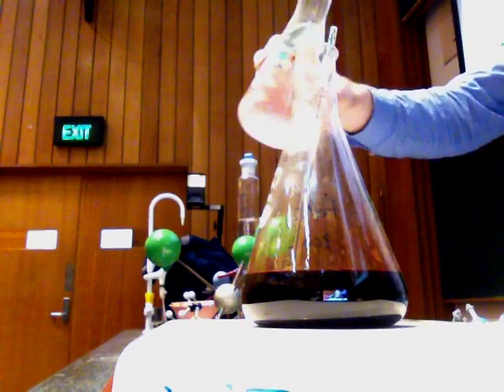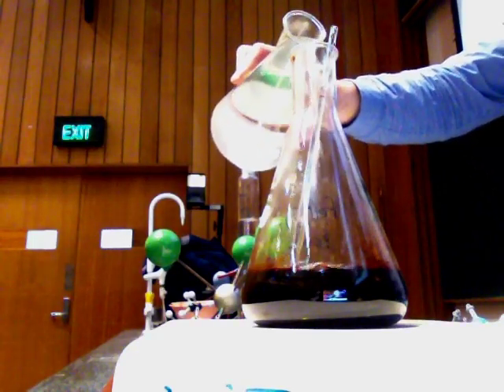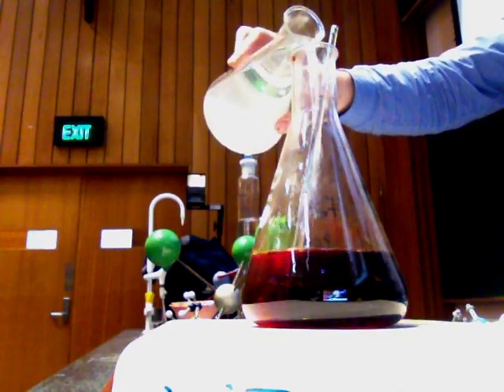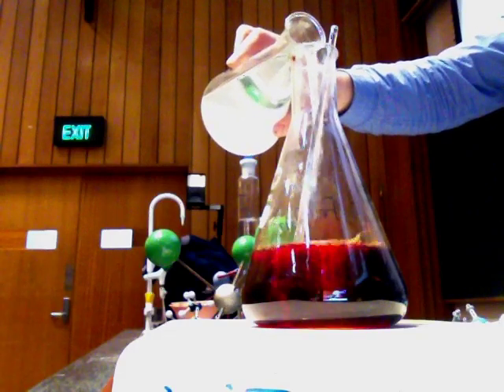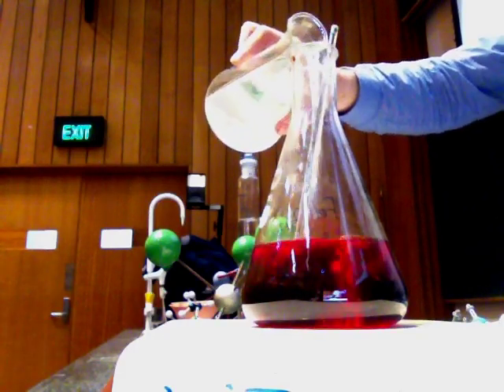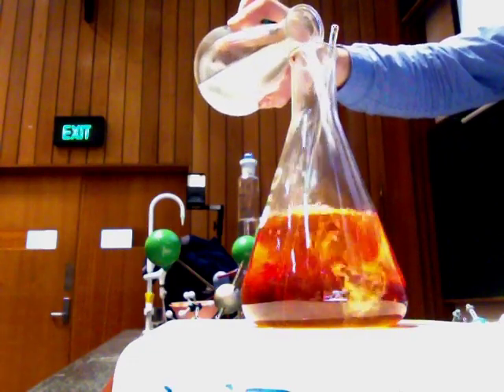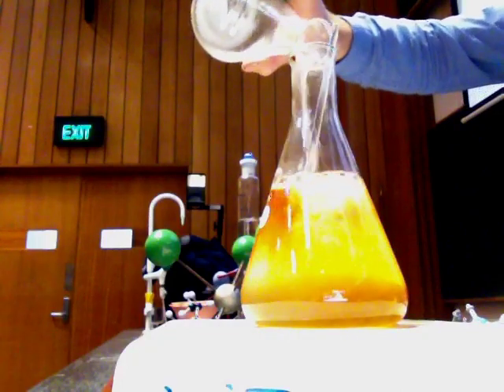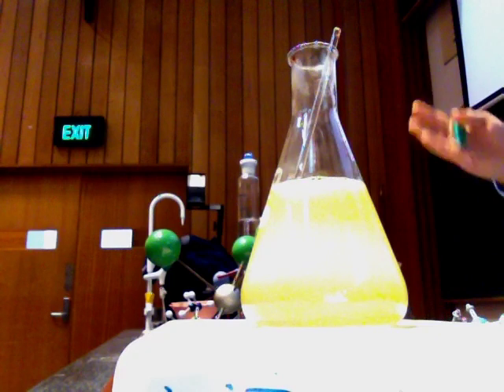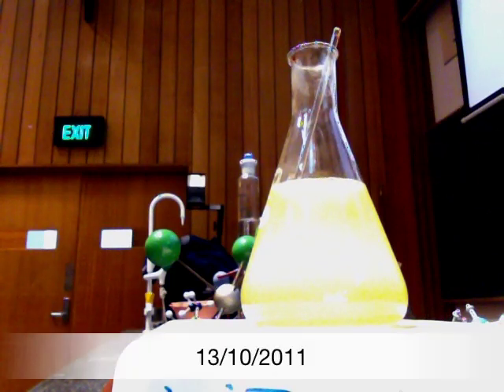So this is spectacular — it gets rid of the colour. Adding the fluoride — it's going a rosé colour, then it's not quite going colourless, but it's losing colour. It's going back to a lemon squash colour. And that's that.